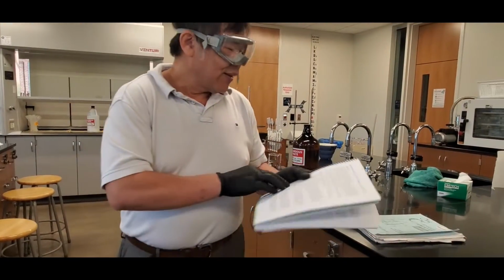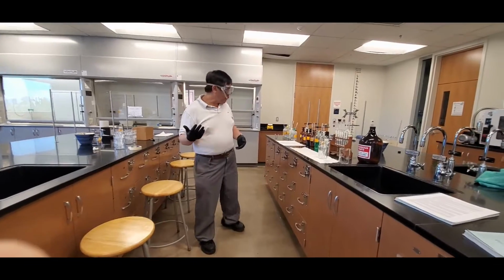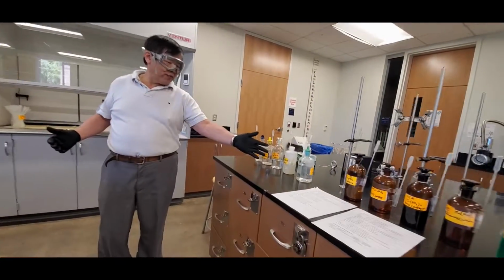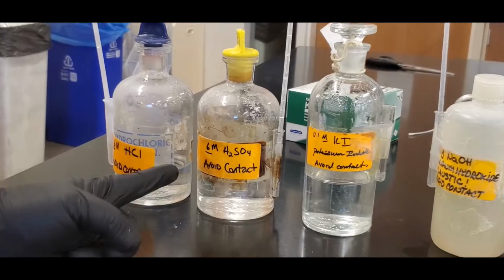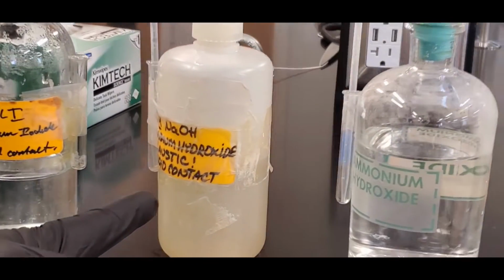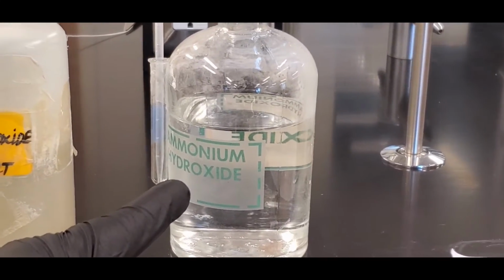Now, let's come over with me. What we've got here is the setup. We've got the 5 processing solutions over here. So we've got the hydrochloric acid, 6 molar, 6 molar sulfuric acid, 0.1 molar potassium iodide, 6 molar sodium hydroxide, and a 6 molar ammonium hydroxide.